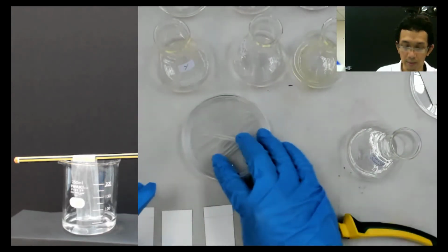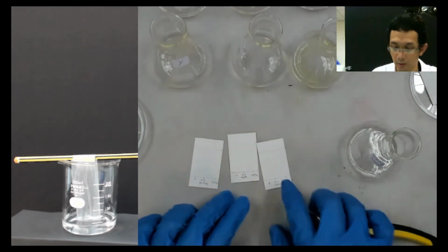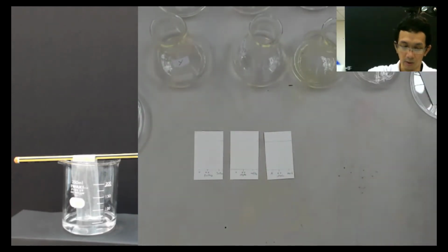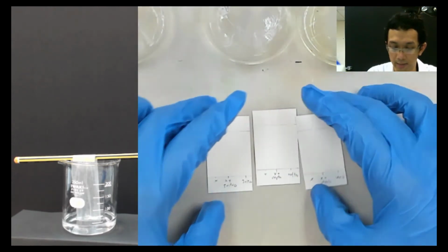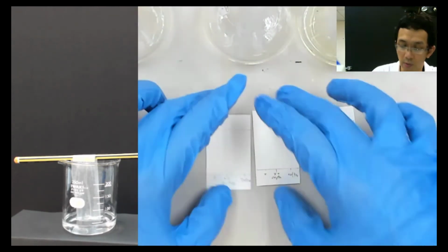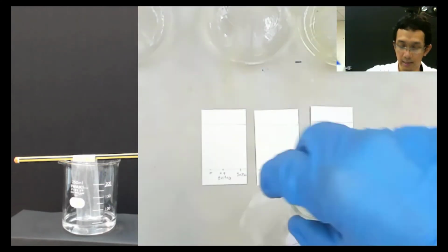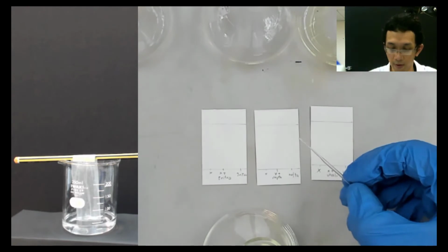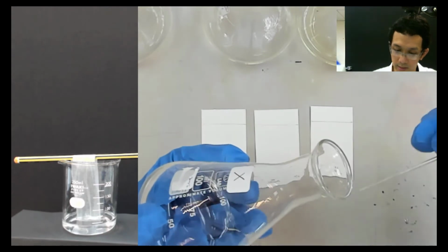So the way you do it, let me put this here a bit. I can bring this over there. Here I already marked these. You can see previously we already marked this as X and X plus whatever. So now we want to spot on top of that. Take X and then take the spotter, the one I just made before, and just take this X.